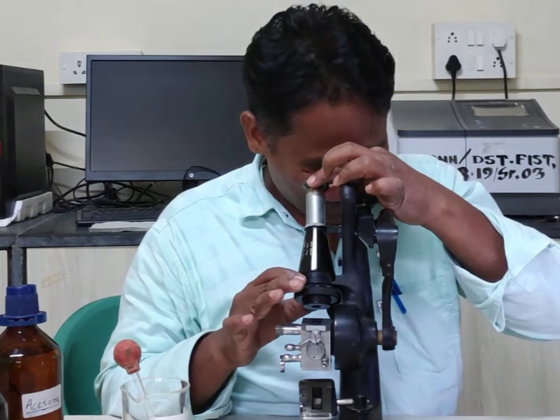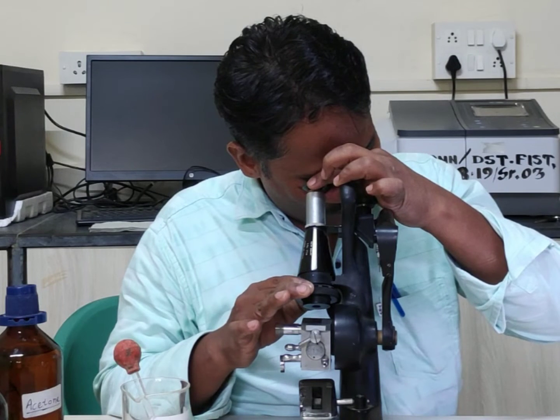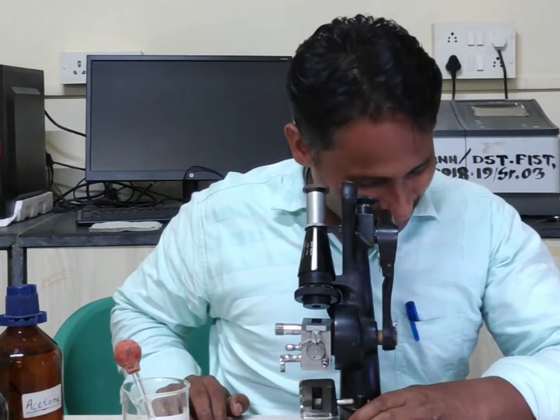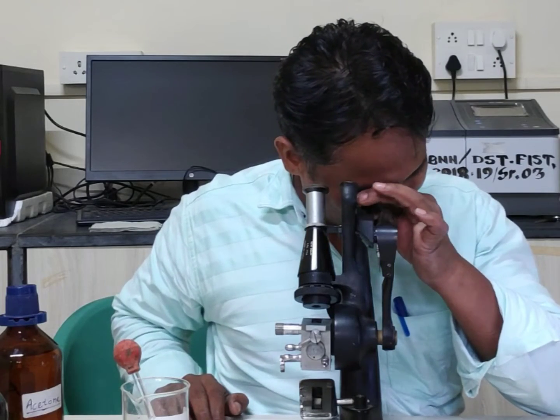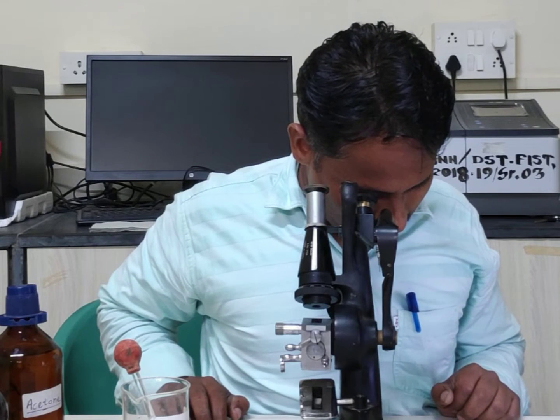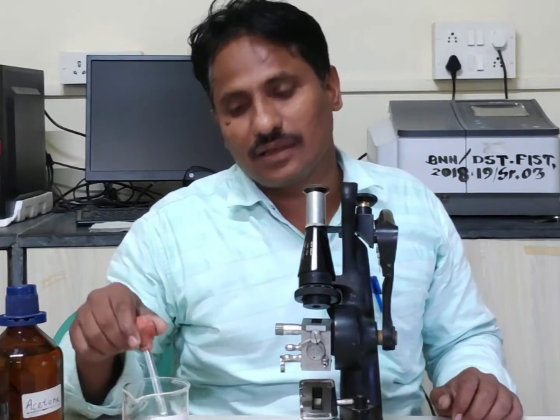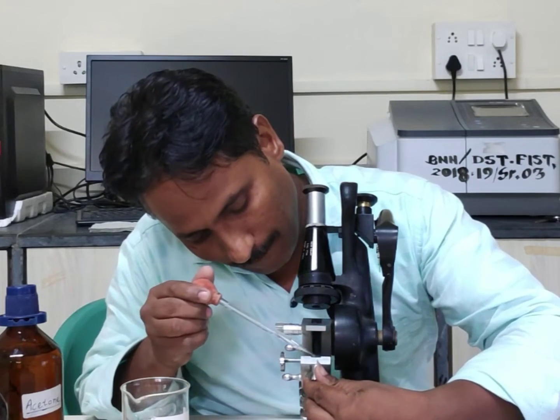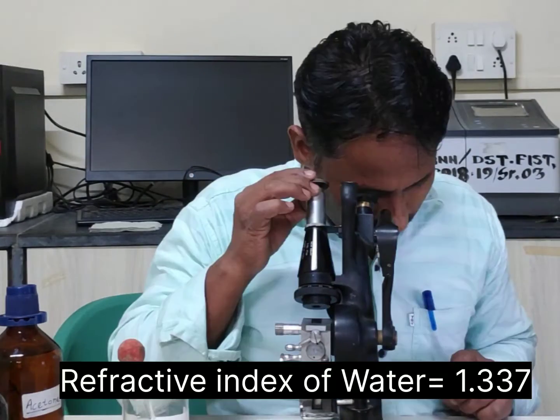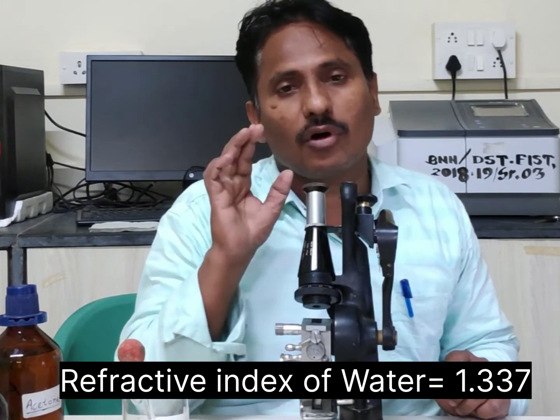With the help of fine adjustment now — great, really great. We are going to see the readings now. It is one point three three seven. So we have seen that we can use this knob. One point three three seven is the refractive index of water, observed through this instrument.